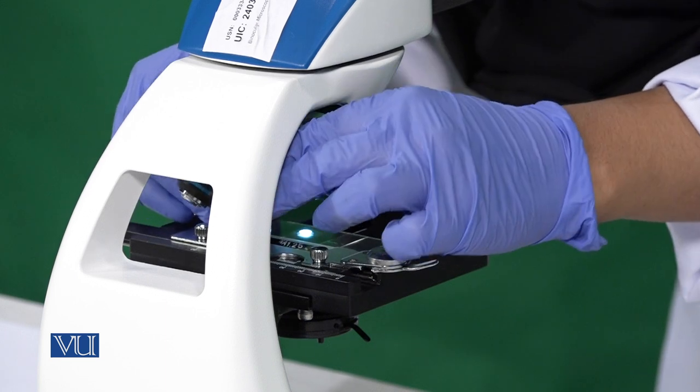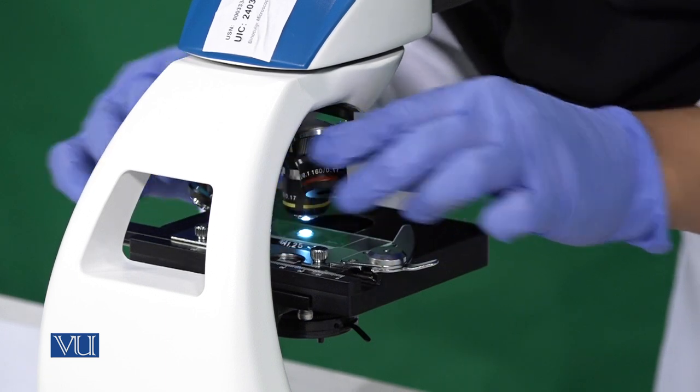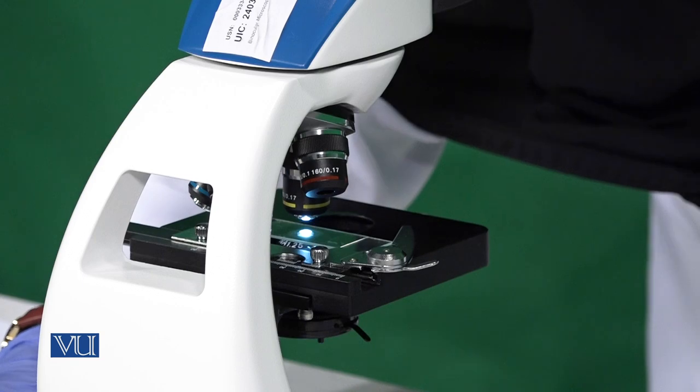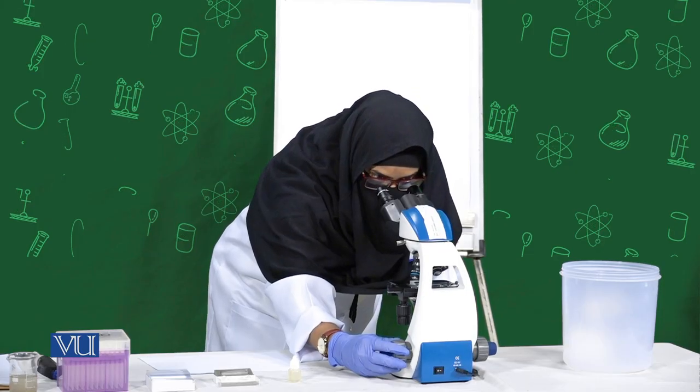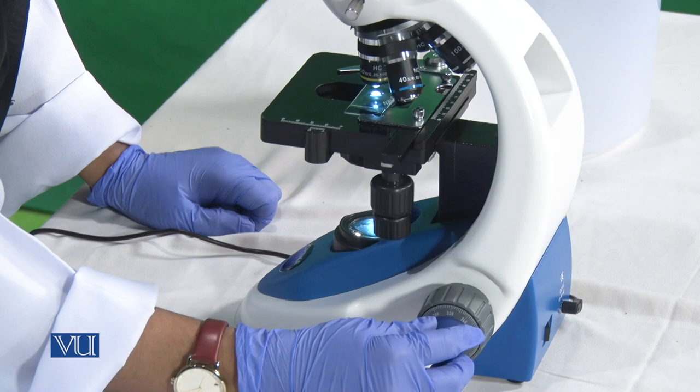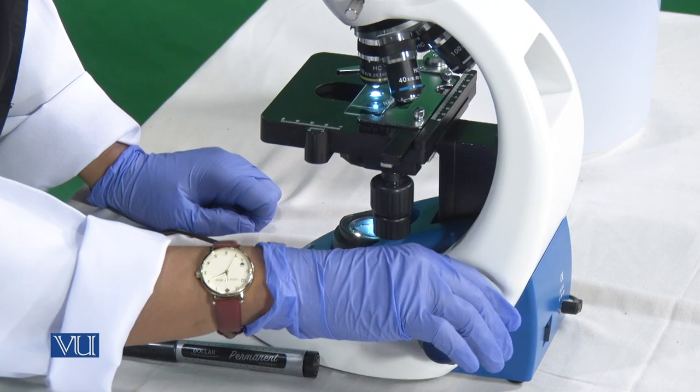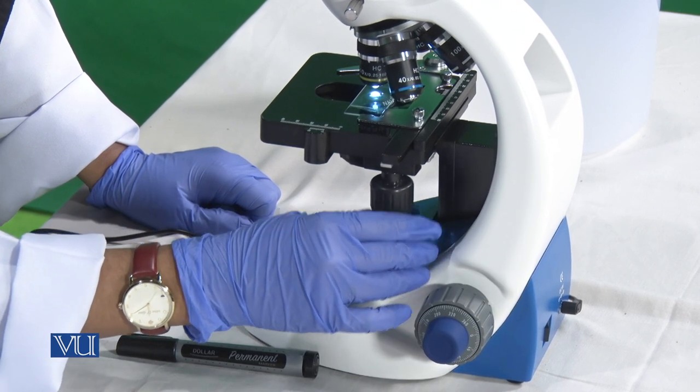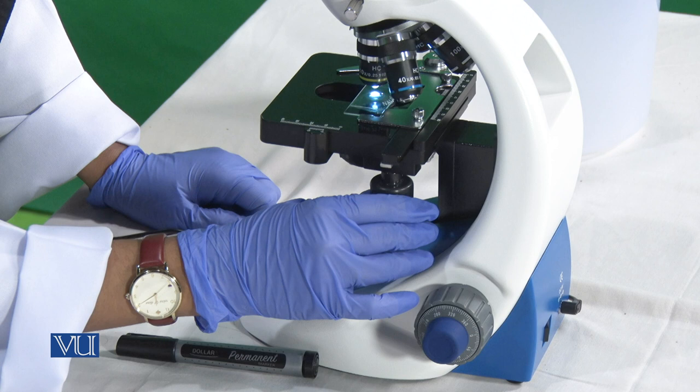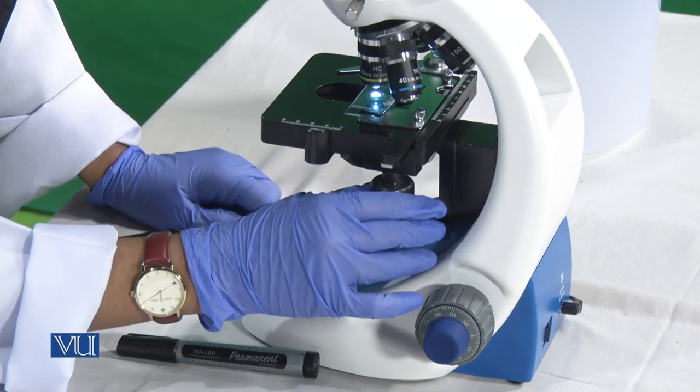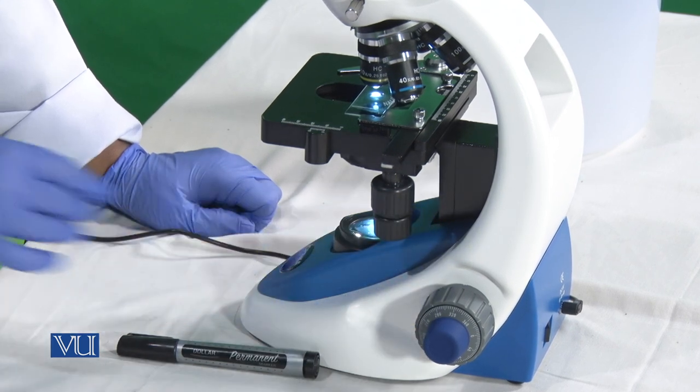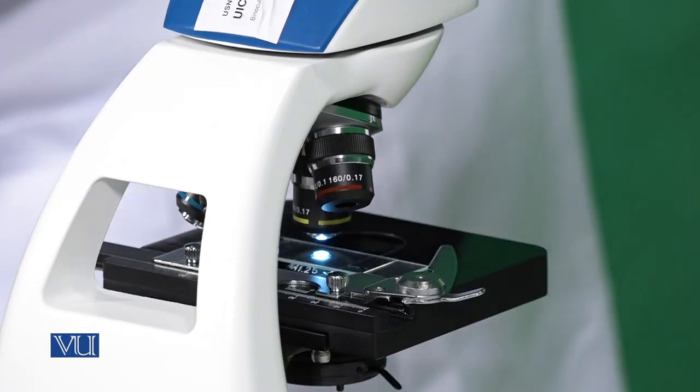Now by changing to 10x, I have visualized a much better view and will report my observation.